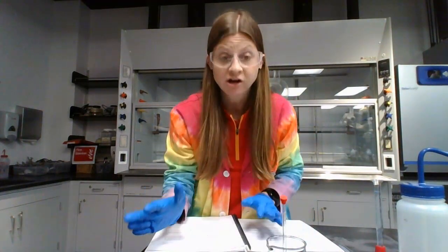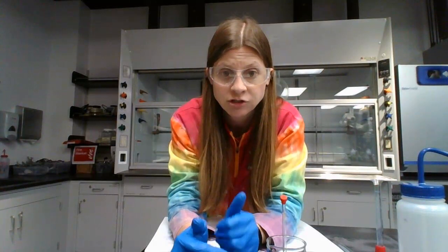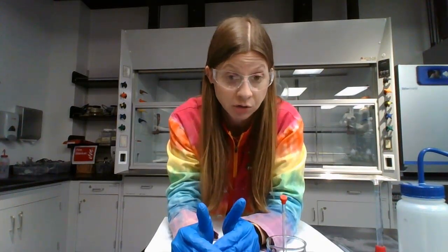So we're taking care of part A. So now we're ready for part B. You and your partner will be assigned either Pedialyte or chicken broth. Your partner group will have the other one. So between the 2 groups that shared standards, one group of 2 will have Pedialyte, one group of 2 will have chicken broth. Okay. So we need to do a couple things.